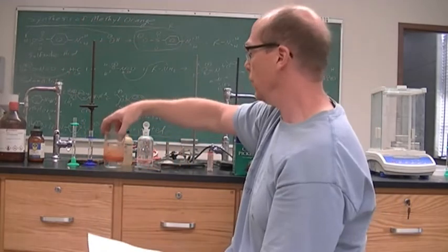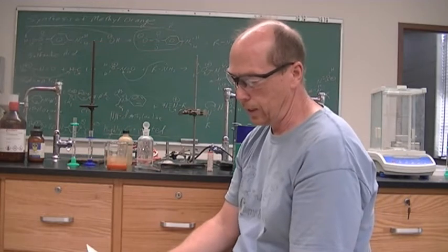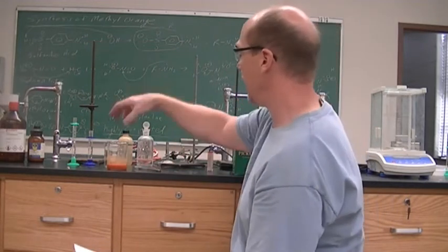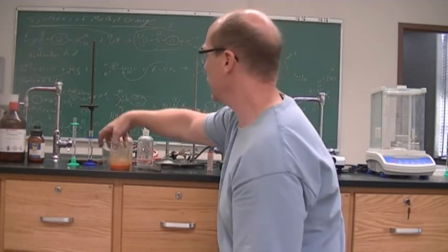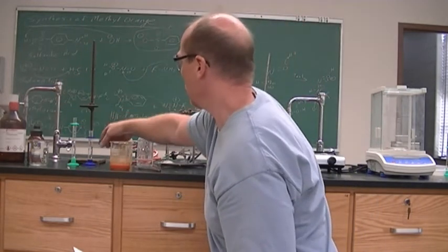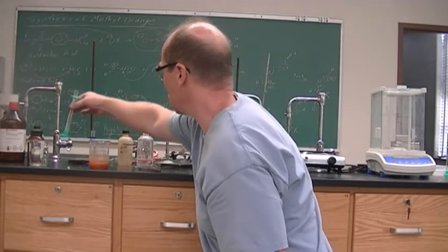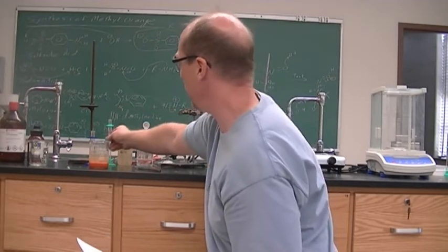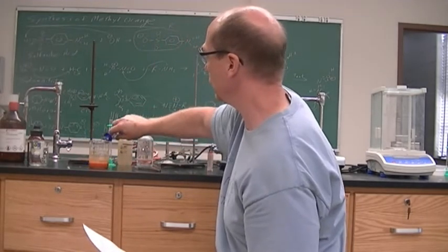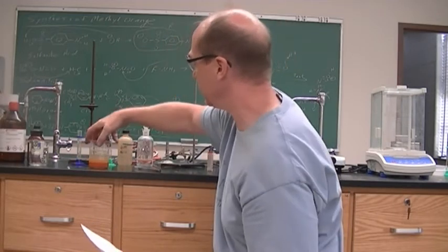All right, and so we want to make sure that this is basic, and so we're going to add some more water and some more 6 molar NaOH to make sure that this is basic.